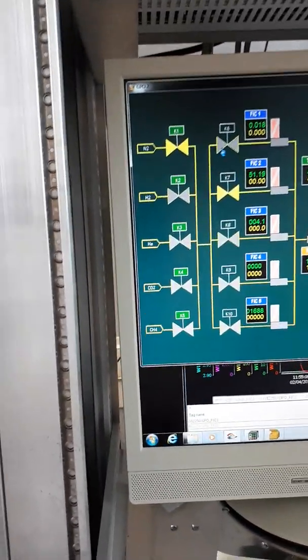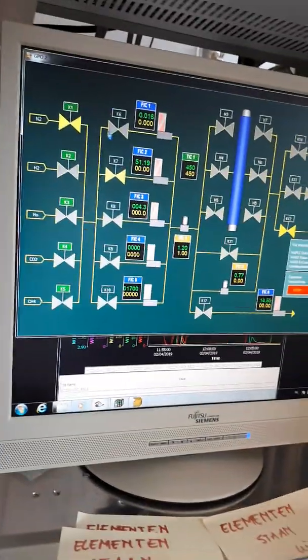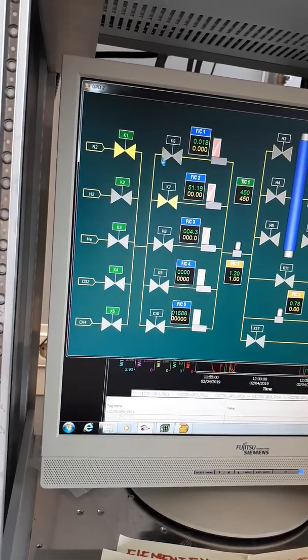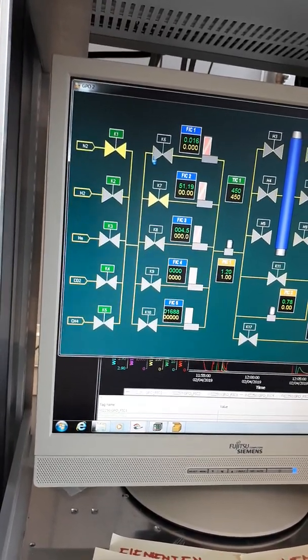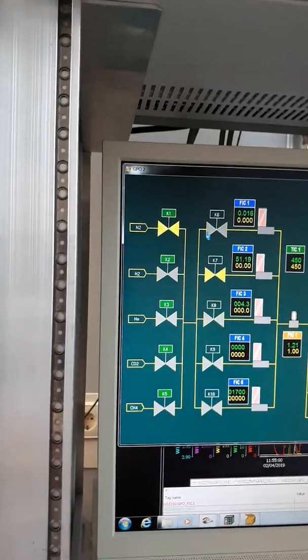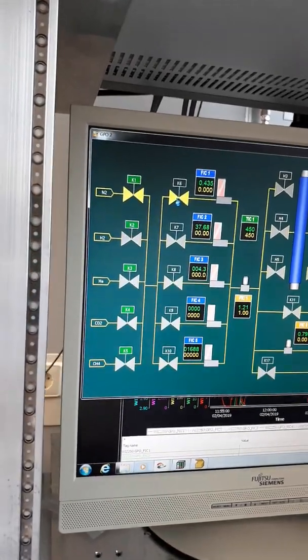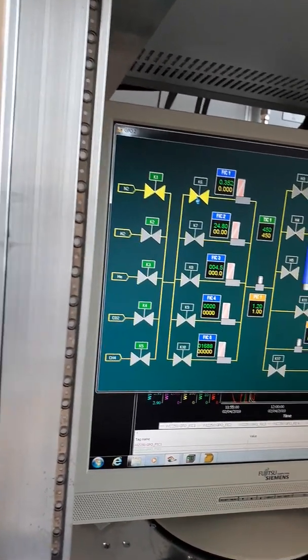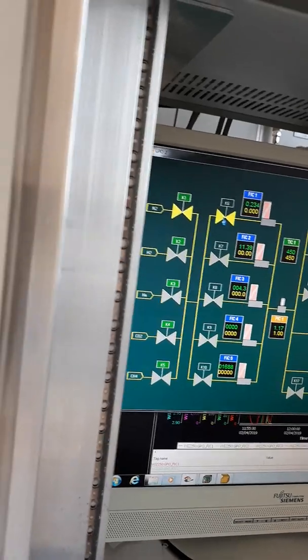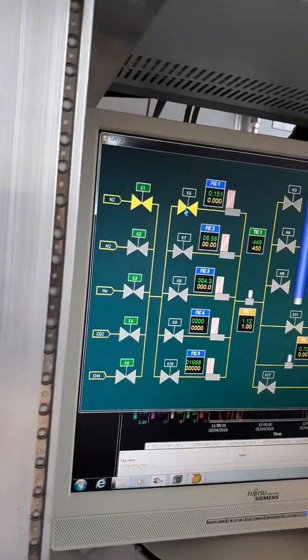But this is what we want to equate for the system, right? Yes. I mean, this green line shows that what you need to feed is always also your leakage. This much volume is leaking from the system, because it's asking for a certain pressure. What goes in is the amount that it's asking, what it's also losing on the back. But it wants to have a certain standard value, so something has to be added. So the amount of feed is what he loses in the background, and in this case your membrane.